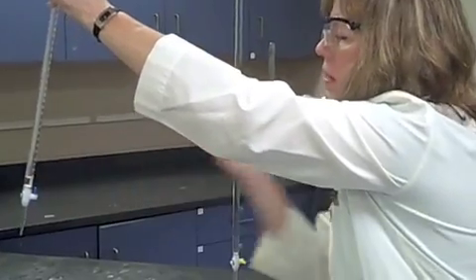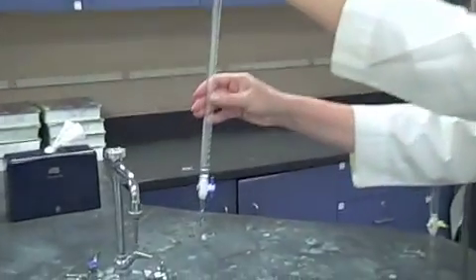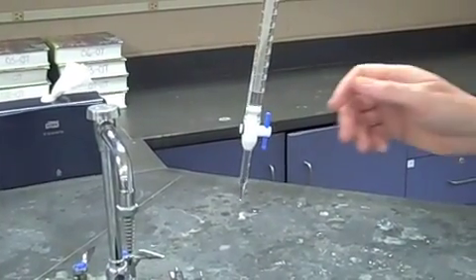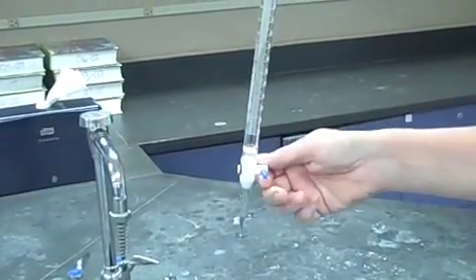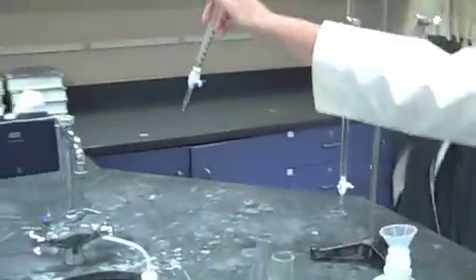Okay. Now do you notice the stopcock is not working properly? It is not a steady string. So you would immediately go over to the event coordinator and ask for a new stopcock, a new burett. And I am going to go get one that I know is working right away.